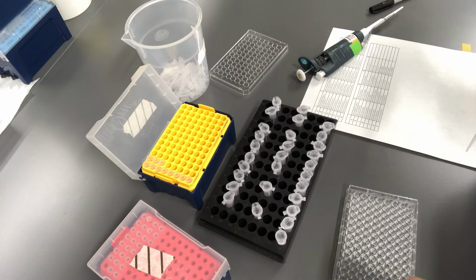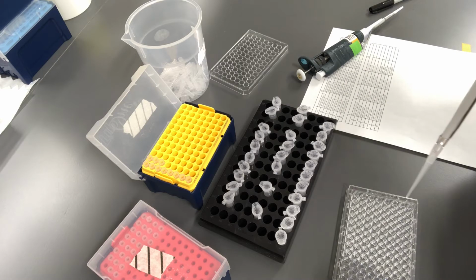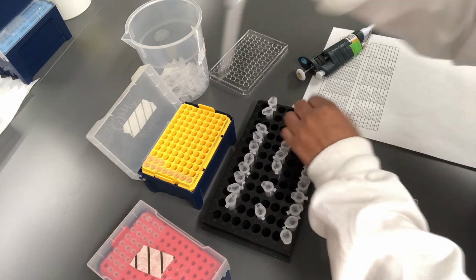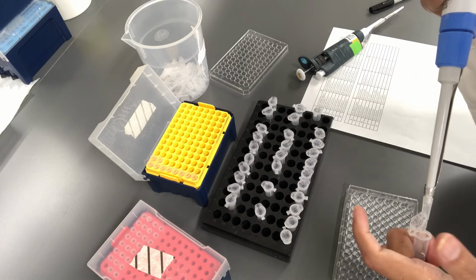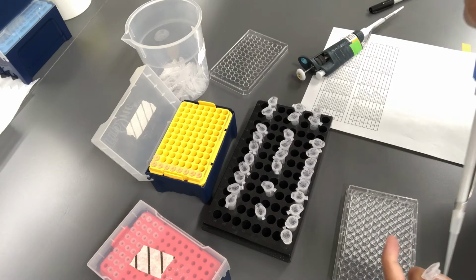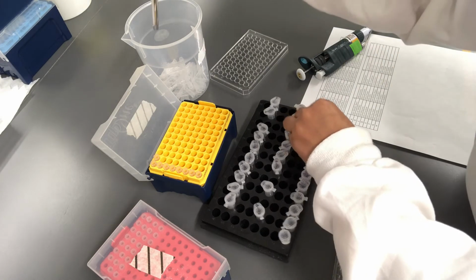And the second one is control with bacterium but no stress factor. Now I'm going to pipette all the other media containing stressors, and those are different percentages of hydrogen peroxide and different concentrations of nickel.